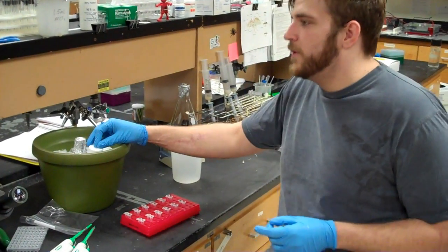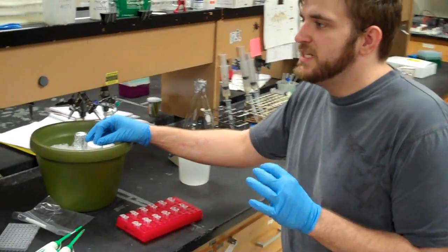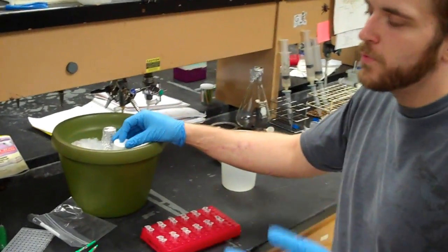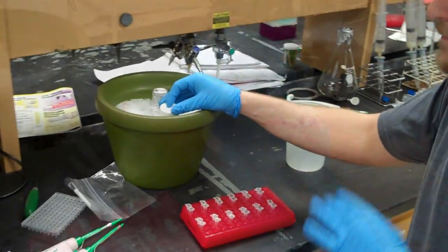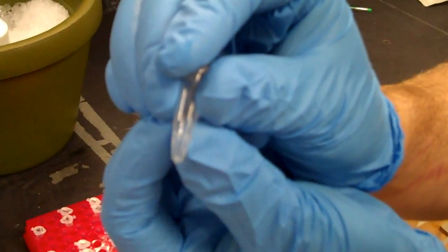The reason why we use ethanol is because the DNA precipitates out more readily in ethanol than in water. And if you can see here, you see actually the pellet, the DNA pellet.